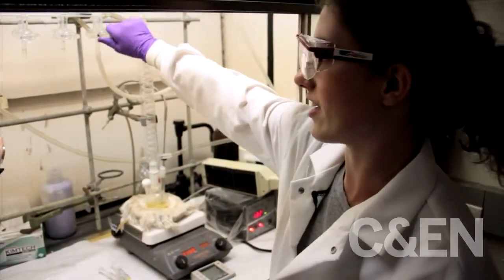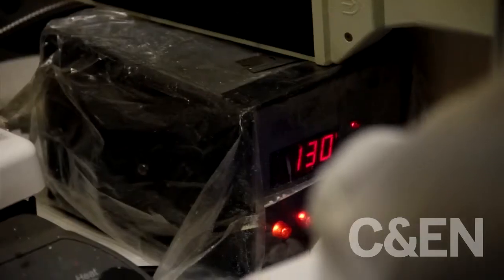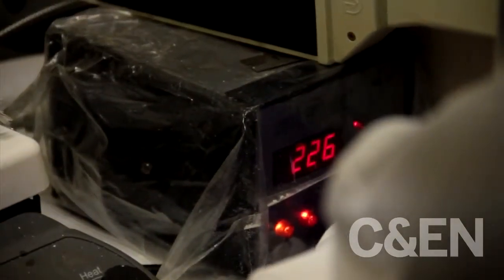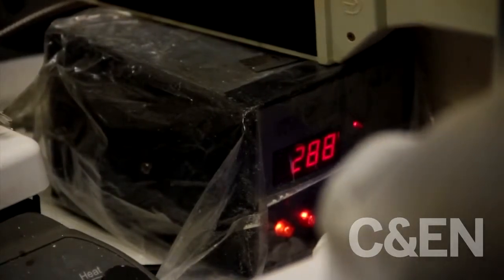So now it's off a vacuum and it's on argon. So now I can turn off the vacuum pump. And I can set the temperature now to 300 degrees and wait for it to heat up.